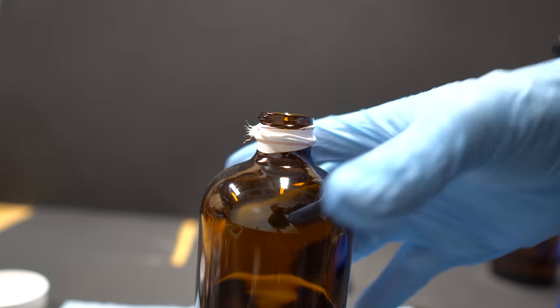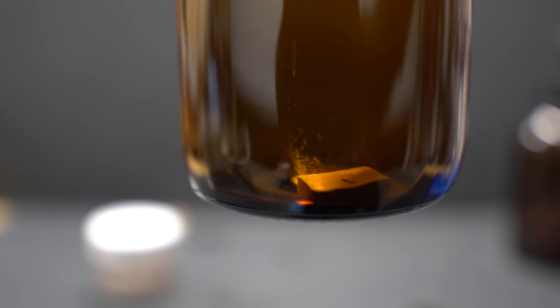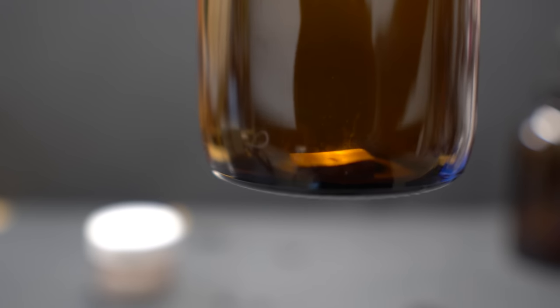Here after the addition of the sodium metal you can see that we actually have a slight reaction in the jar. You can see that a little bit of hydrogen gas is being released as there was some residual water in the diethyl ether. It only reacted for a little bit and eventually no more bubbling happened and it was safe to store.